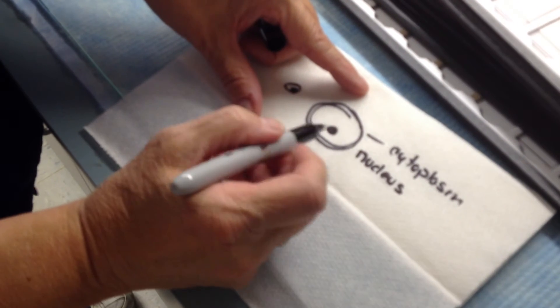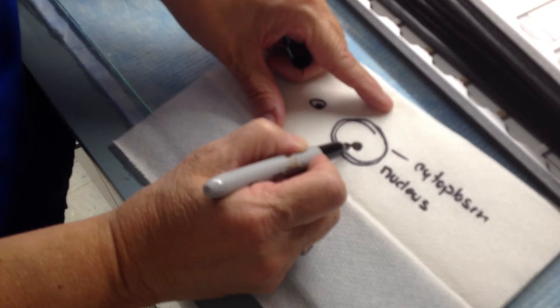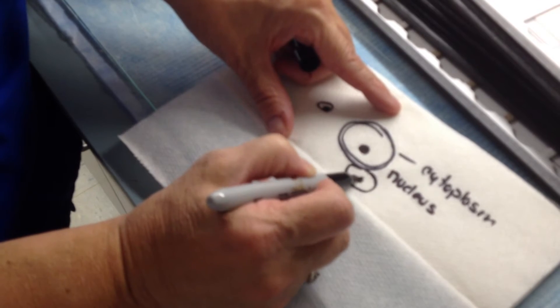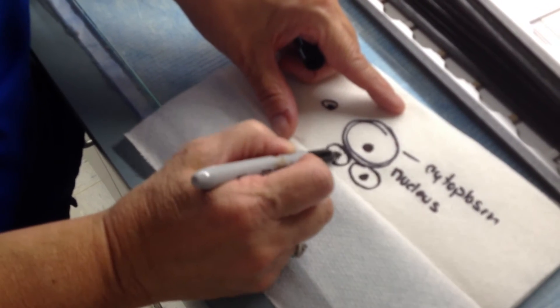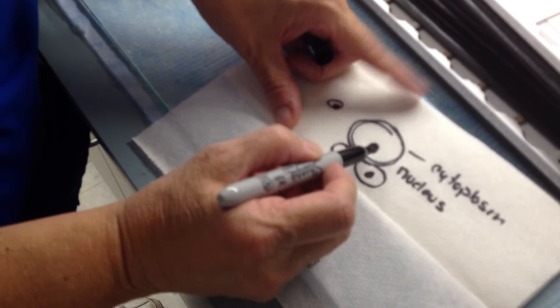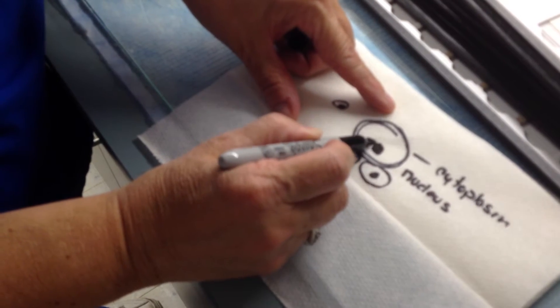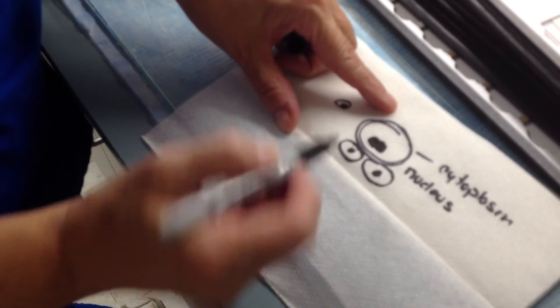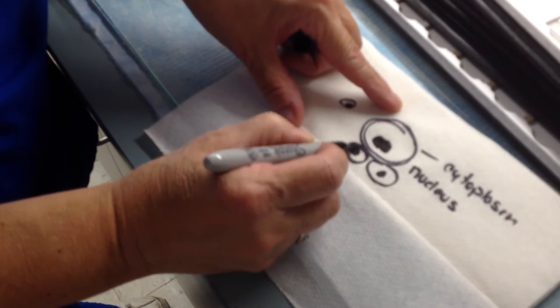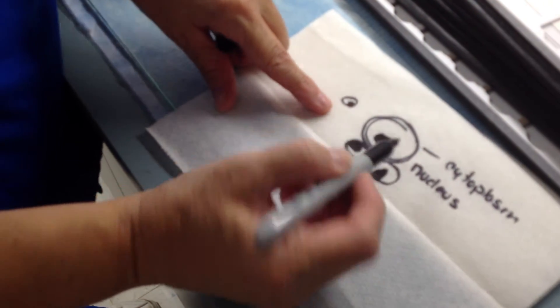Inside the nucleus — when you have cancer, the nucleus is what starts it, because cells duplicate over and over all the time, they die and start over. When there's cancer, the nucleus starts taking on different shapes. It might be shaped like this or that — it just doesn't know what to do anymore because its memory is all messed up.